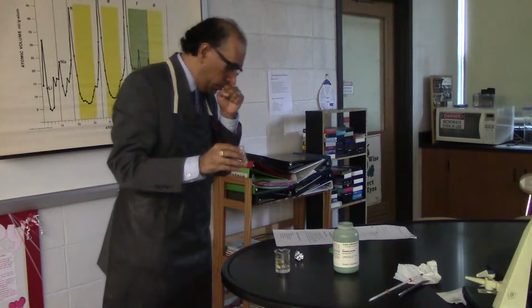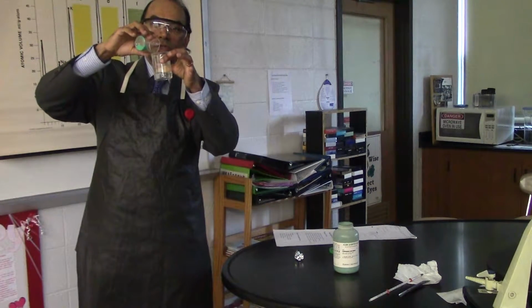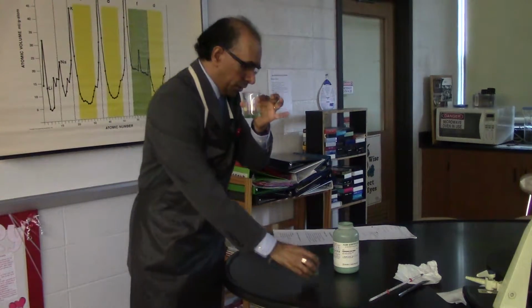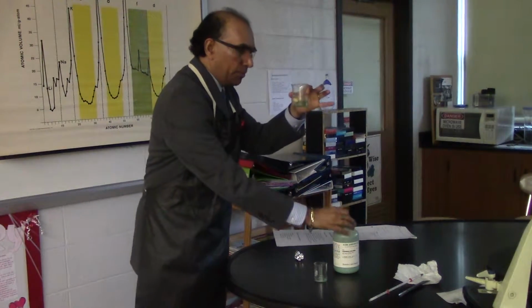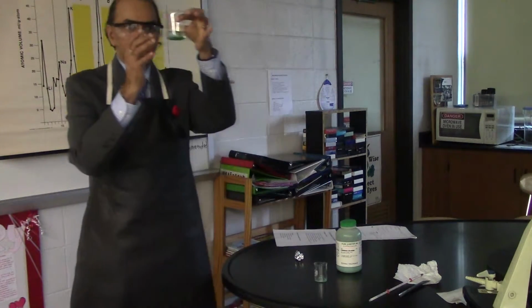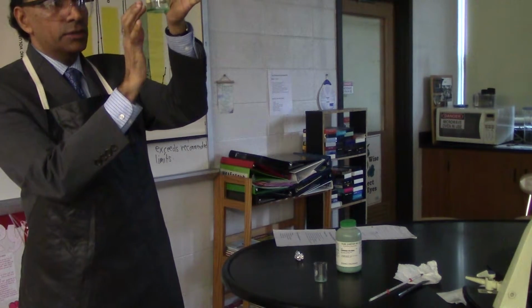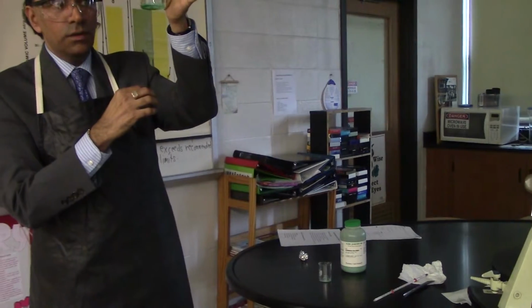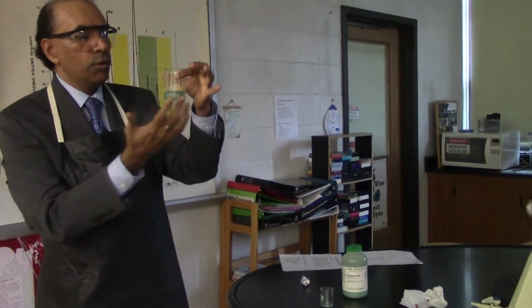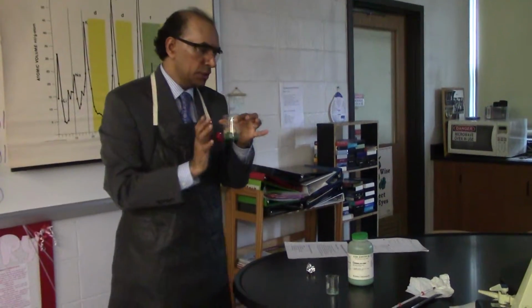The second step, you're going to create a new system by asking students to pour your dry copper 2 chloride into your beaker of water, unstirred. In this case, students should notice that you have a heterogeneous mixture, because at the bottom you have a lot of undissolved solid, and at the top you have lots of water. They can write down whether there was an immediate color change, whether it's a homogeneous mixture or heterogeneous mixture, etc. All right, so that's your second system that you're studying.